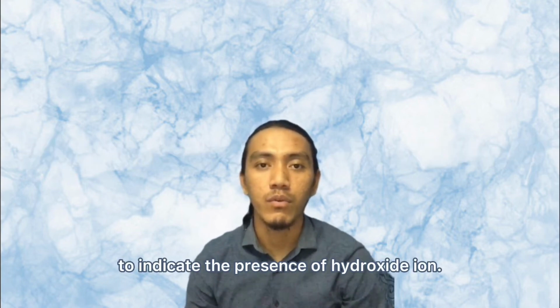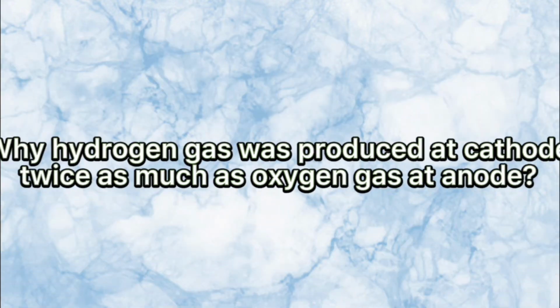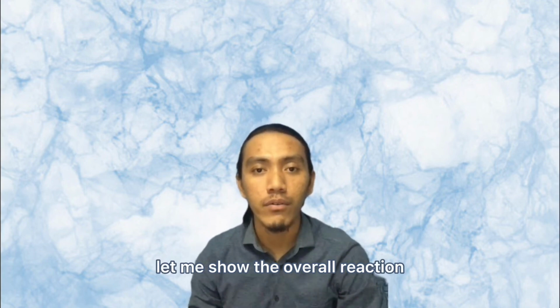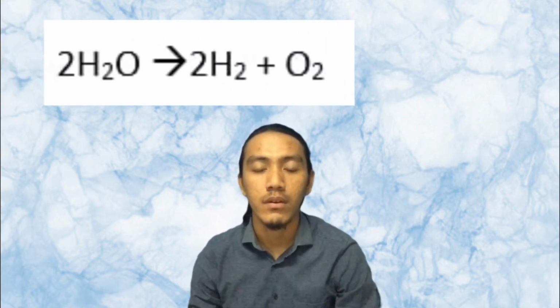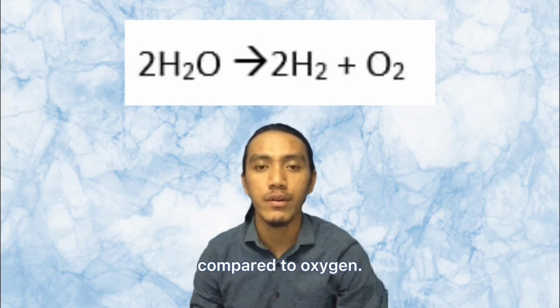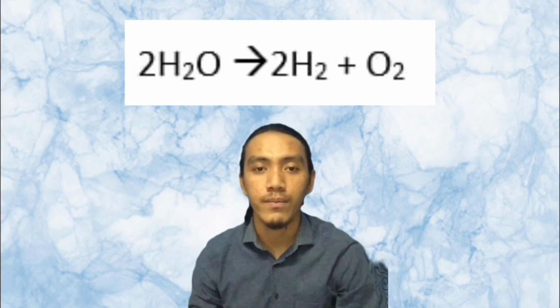Phenolphthalein is used to indicate the presence of hydroxide ion. Before that, let me show the overall reaction of electrolysis of water. From that, 2 moles of hydrogen gas are produced compared to oxygen. This is why more bubbles are produced at the cathode.